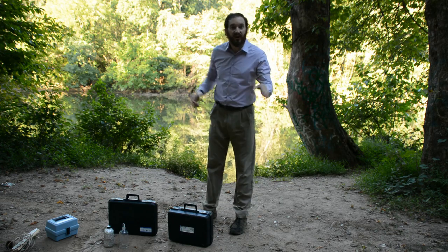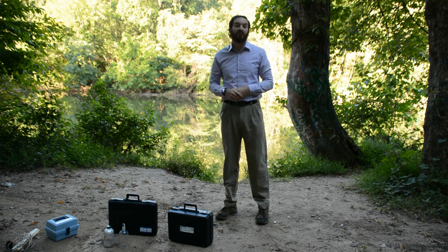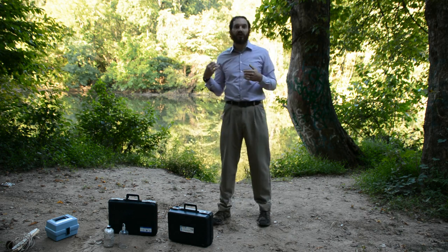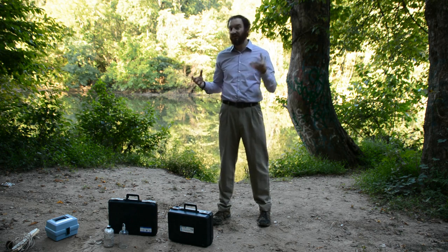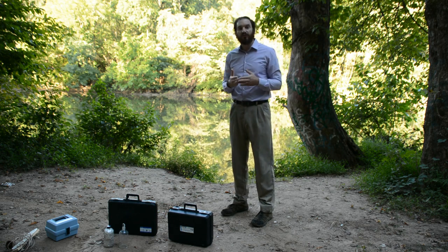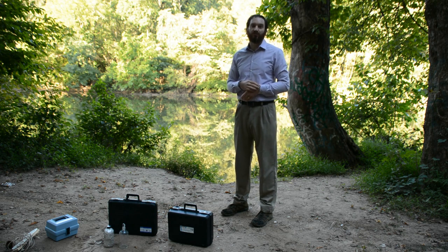Here we are today. We are doing the first part of our primary productivity lab. So that is going to require us to get a couple pieces of data about the Neshaminy Creek before we put our apparatus into the water. Remember, our apparatus has a light bottle and a dark bottle. They're going to be filled with the same water source, and then we are going to look to see if there's a difference in the dissolved oxygen after sitting for 24 hours.